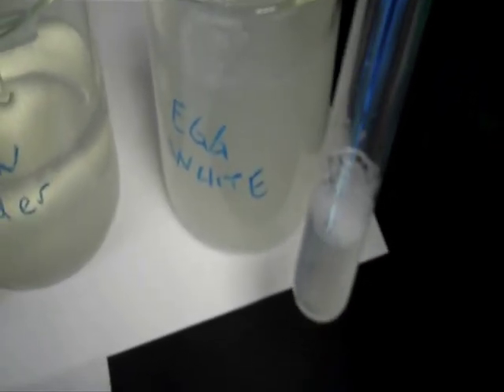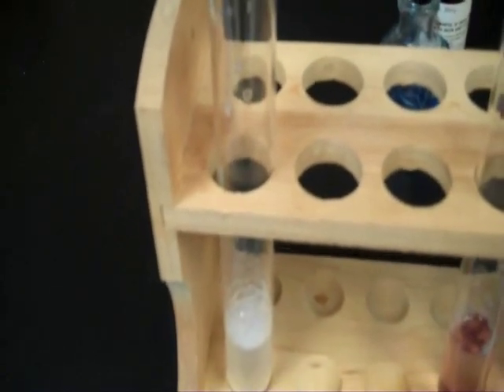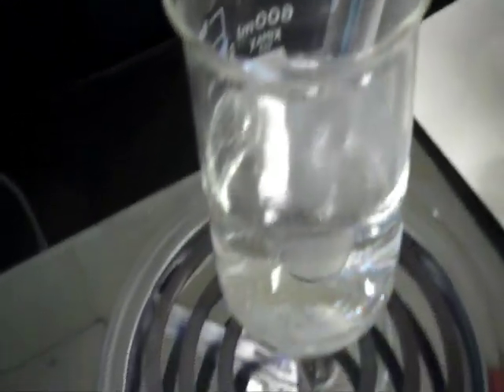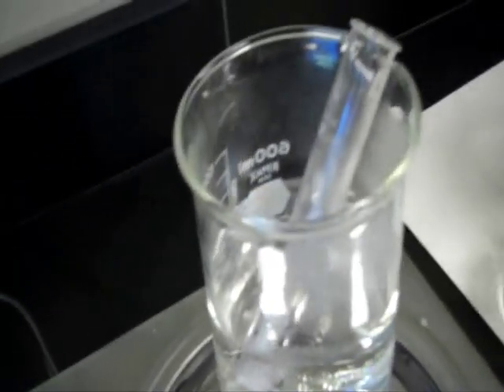The protein we're going to use in our experiment is egg white albumin. We're going to see how we can denature egg white. We're going to try and denature this protein, albumin, in one of a couple ways. One way is by heating it. Another way is using an acid — we can use hydrochloric acid, but lemon juice is acidic enough and available.